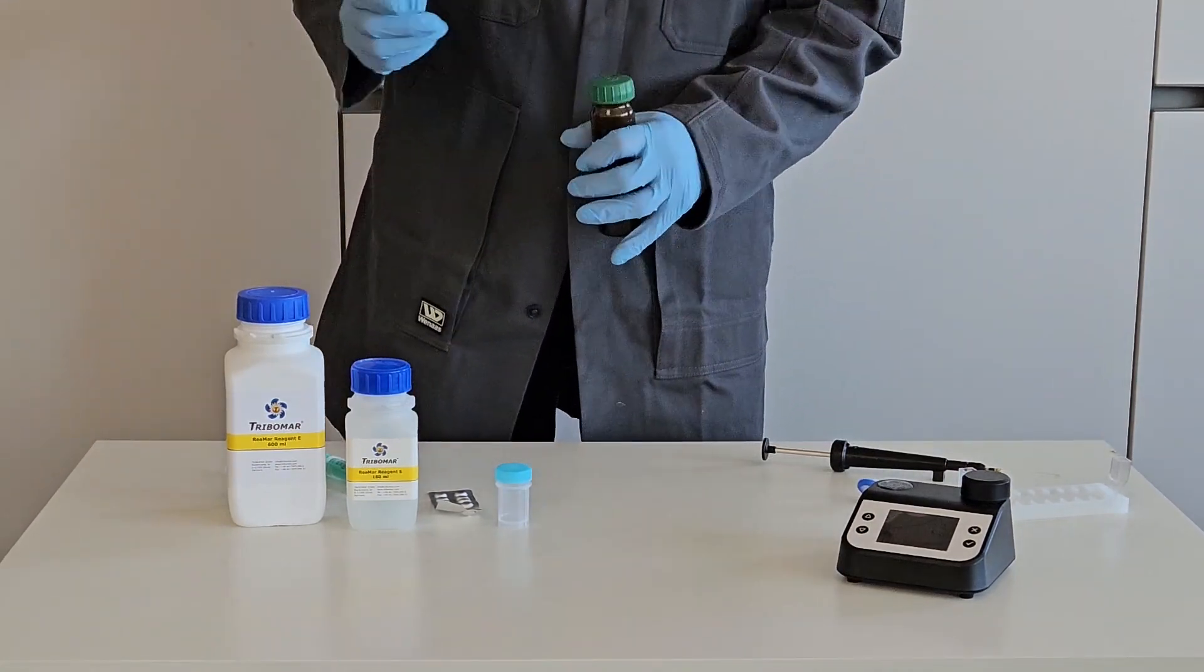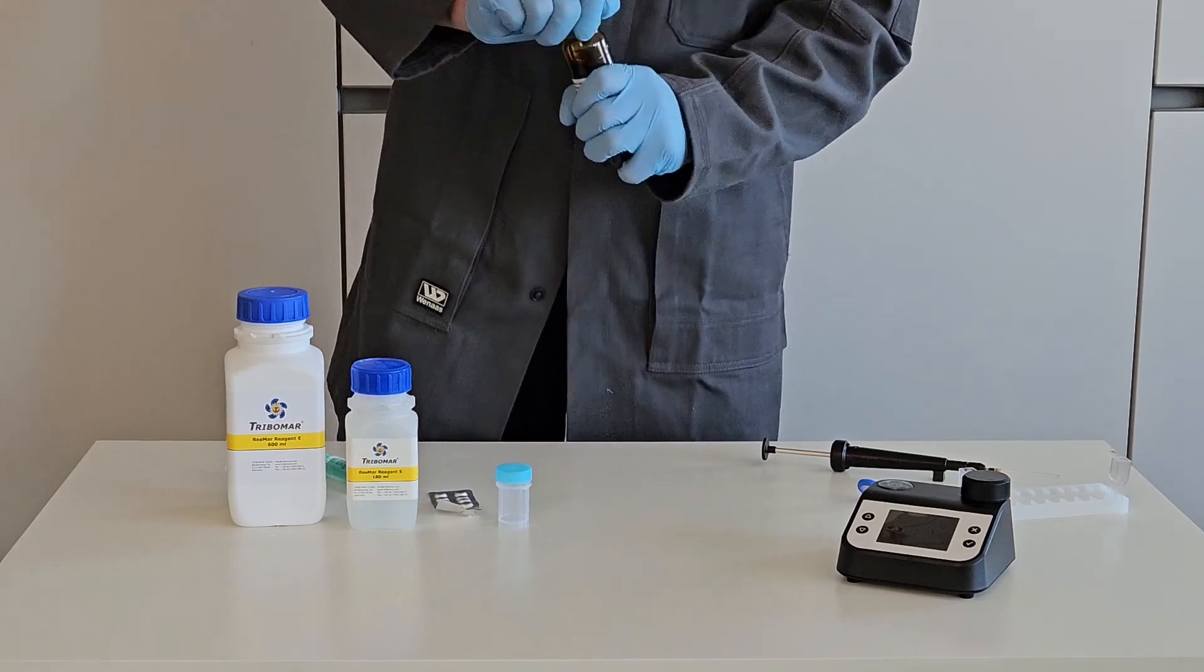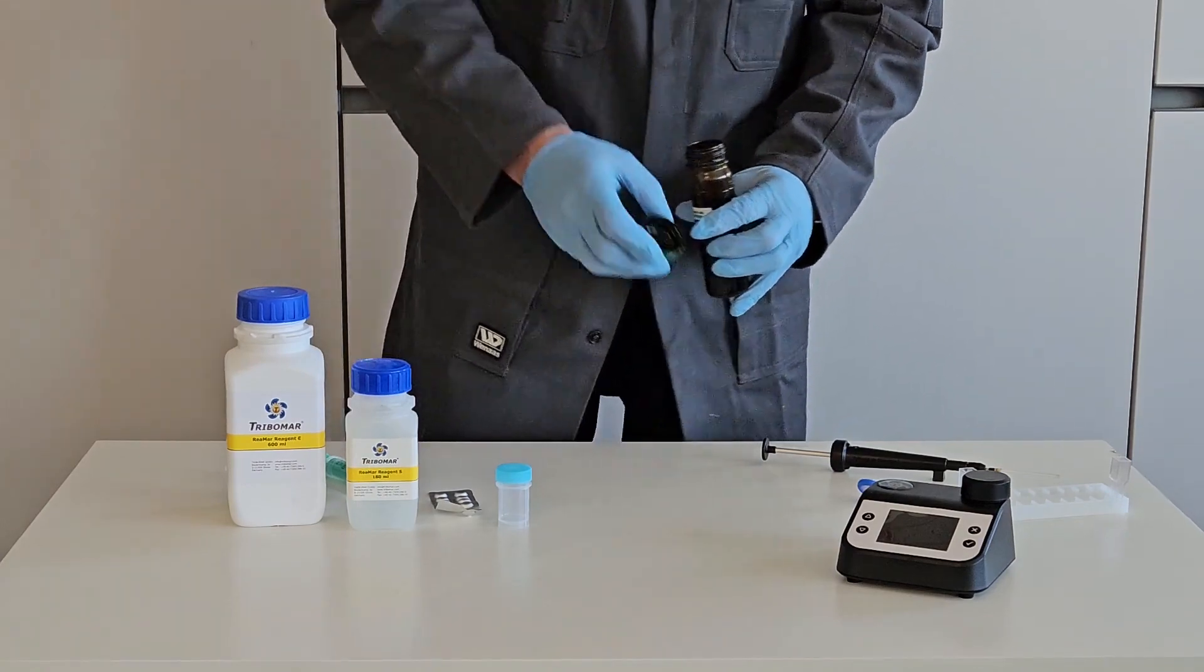At first, we prepare the sample and fill 0.2 ml of lube oil into the vial using the precise automatic pipette.